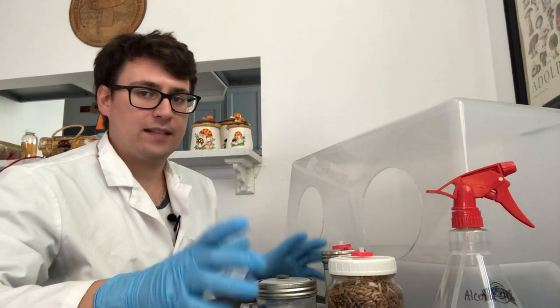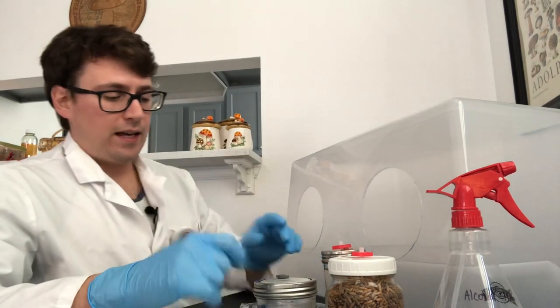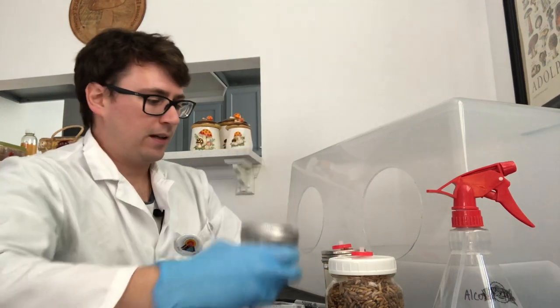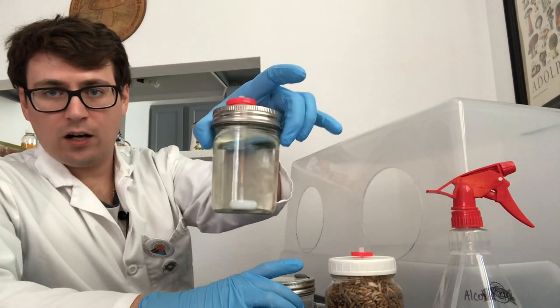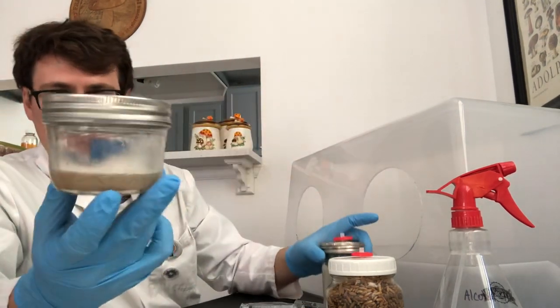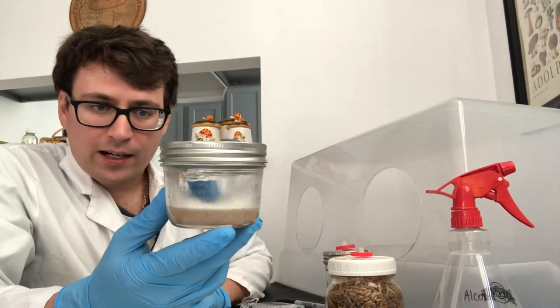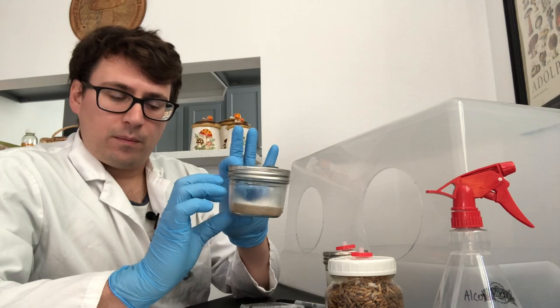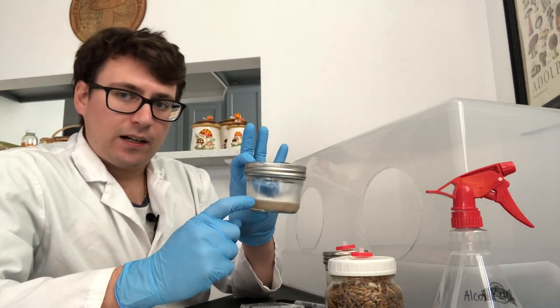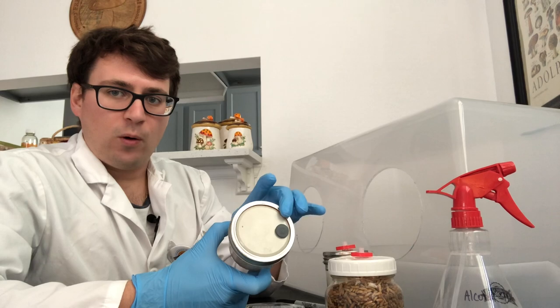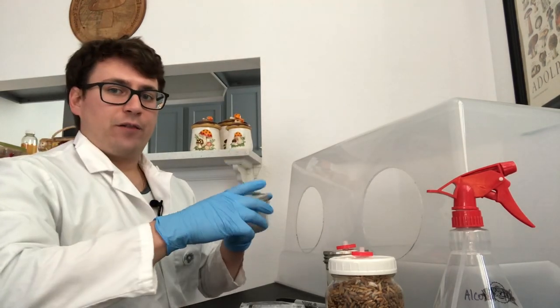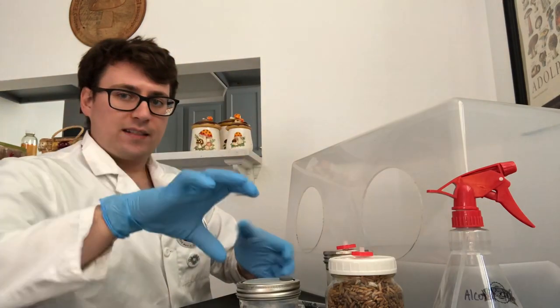Another way to prevent contamination without a flow hood is to use injection ports, especially on liquid cultures. This is a no pour agar culture so you can put the melted agar into a jar with a port and then cook it, so you don't need a laminar flow hood to pour it in a sterile environment.